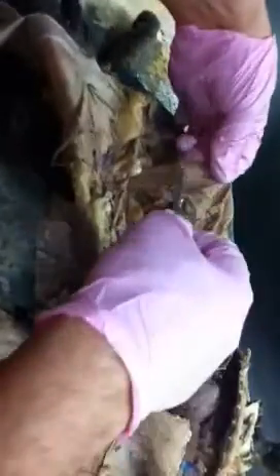The way that we would want to do that is where it's actually going. I'm not real crazy about that superior mesenteric. There's so many other better vessels on here. But again, we'd know it by the diameter. So this is going to be the small intestine, and this is going to be the large intestine. Going to the small intestine would be the superior mesenteric. If we went down lower, we should have some artery going to the inferior mesenteric. These guys did such a lousy job. I doubt we could find it.